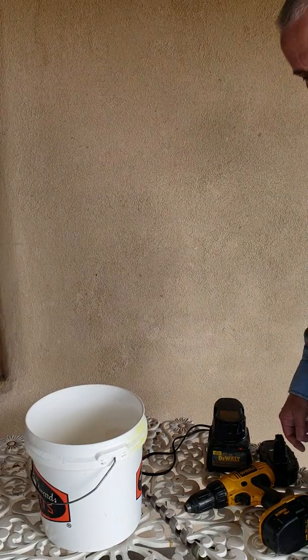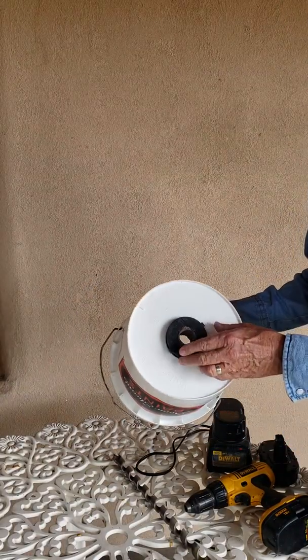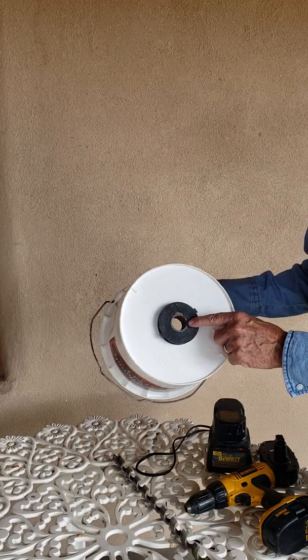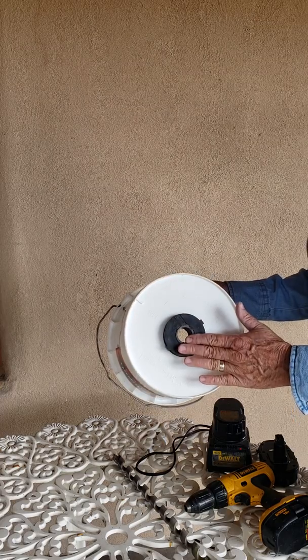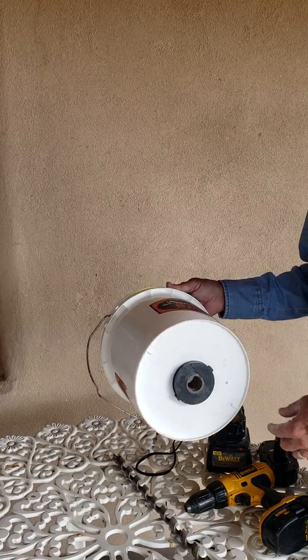The tools you need to do simple soil sampling will be a two-gallon paint bucket with a one-inch bulkhead fitting placed in the bottom, and then you use a threaded pipe nipple and screw into that to protect those threads. You cut it off. That way it gives you the right diameter hole for the bit you'll be using to do the sampling.